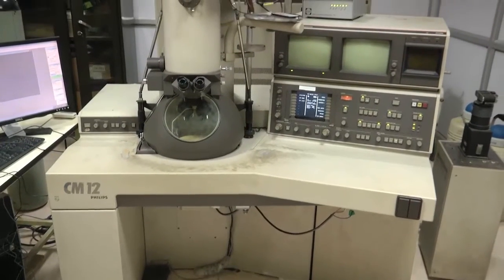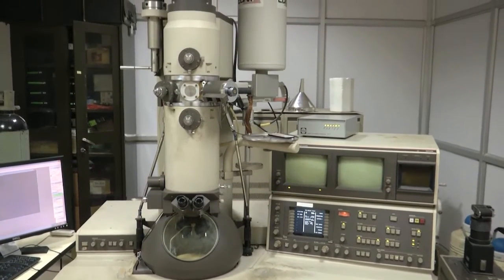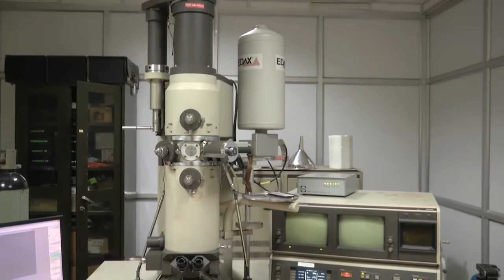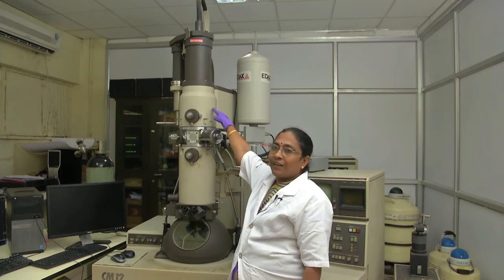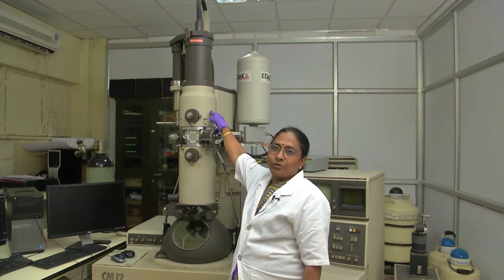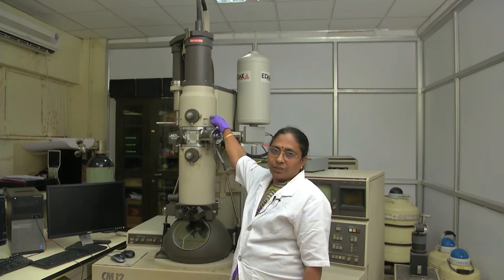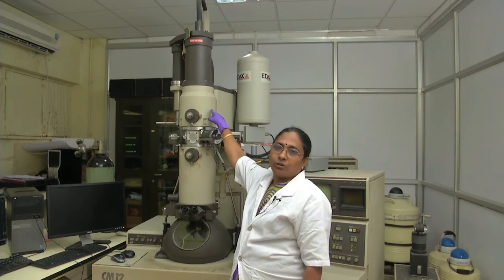Hello everyone, welcome to our transmission electron microscopy laboratory. Today I am going to talk about the transmission electron microscope. What you are seeing here is a 120 kV transmission electron microscope. In the transmission electron microscope we are using an electron beam to form the image. Because of the shorter wavelength nature of electrons, you are getting a high resolution.